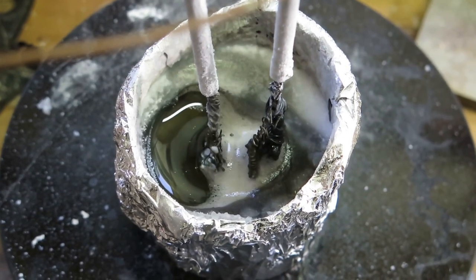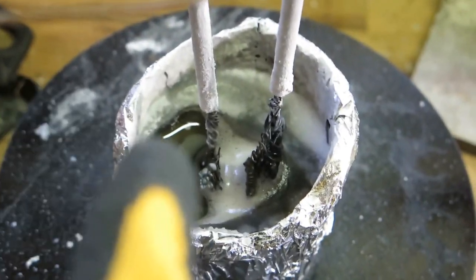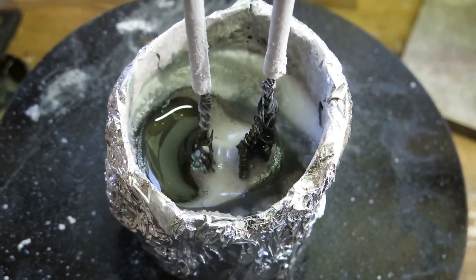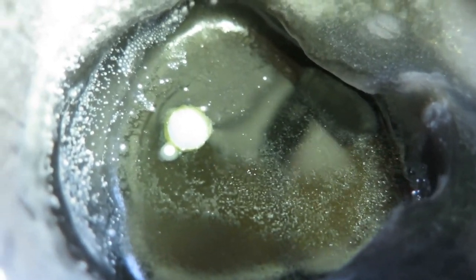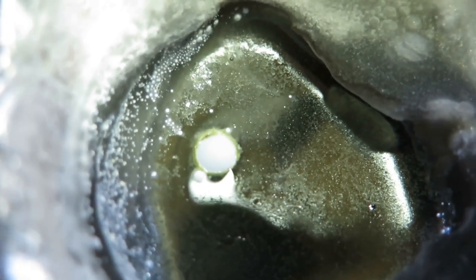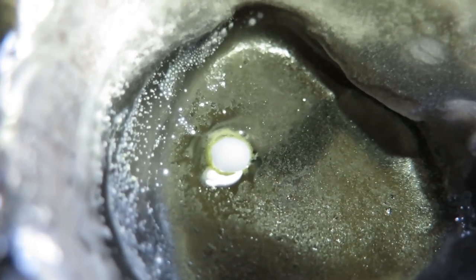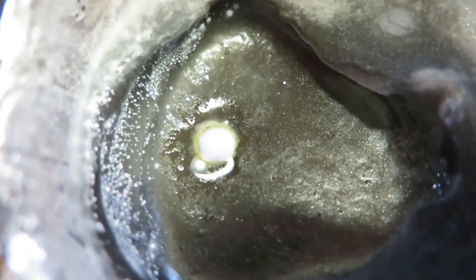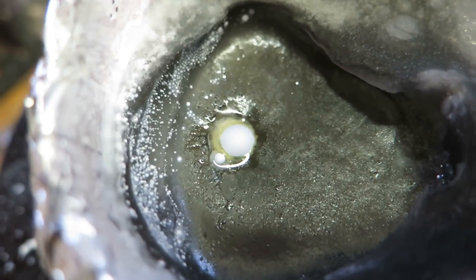The positive electrode is almost completely frozen in. And on this side there's a lot of molten material. It's quite strange. But really strange thing is also that at this point where the sodium is near, the hydroxide is nearly frozen, there aren't these effects on the sodium bubbles, as you could see where the temperature was much higher. And also I don't see any fumes emitted from this thing anymore, so that's really interesting.